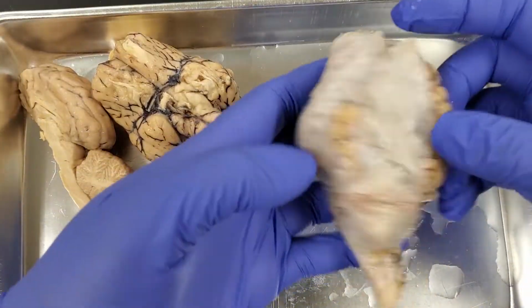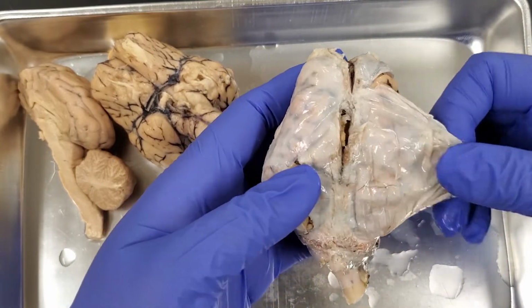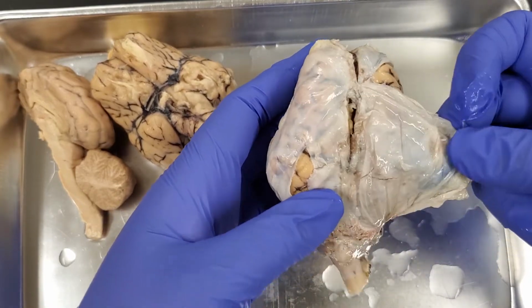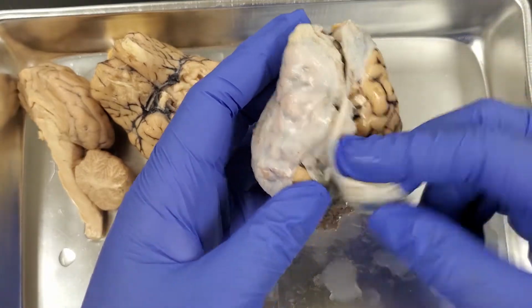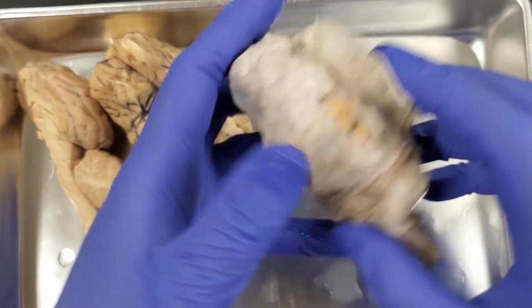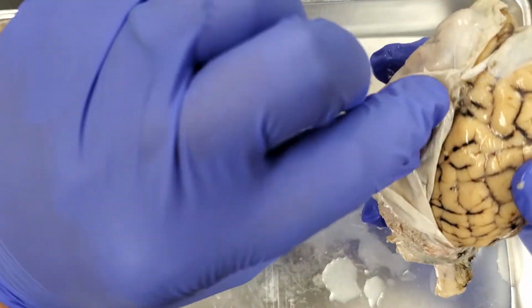So I want to start with this brain here, and you'll notice it looks a little different because it's all got this white connective tissue on it. If you remember, the meninges are there to help protect the brain. The most superficial meninge is this dura mater, and it's actually really tough, and you'll notice it's connected to the brain. It goes and folds into the brain. It separates structures, and then underneath that, which I don't really see very well, you can see parts of it here.